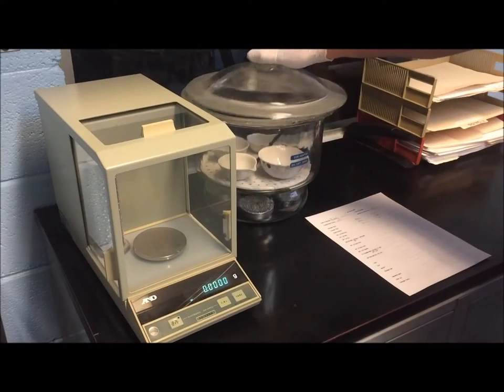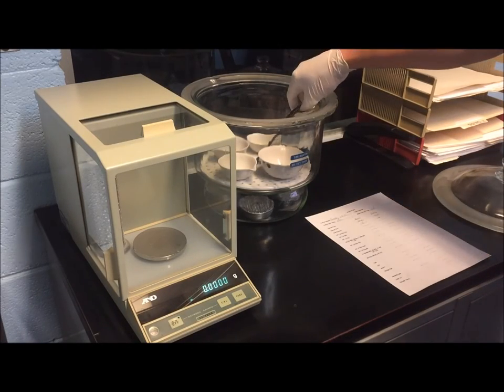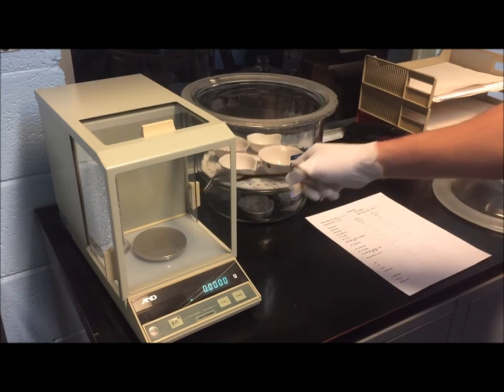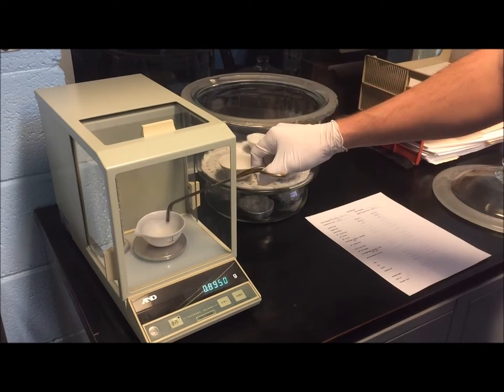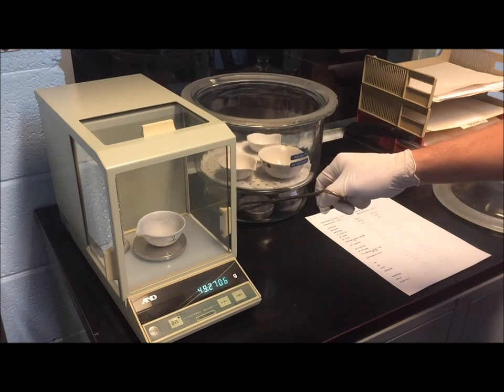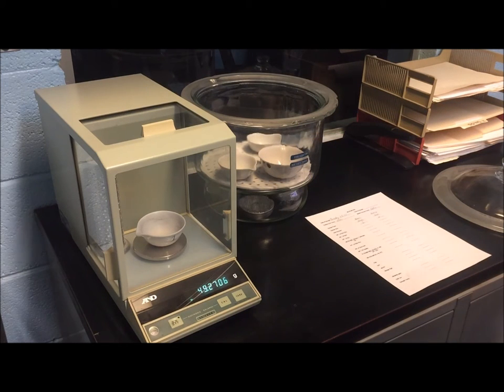To do a mixed liquor suspended solids test, we must first weigh the ceramic dishes with no sample. The dishes are stored in a desiccator to keep the dishes from absorbing any moisture. The blank dish weight is recorded.